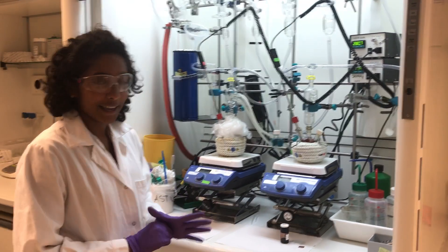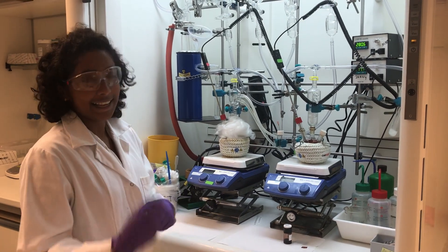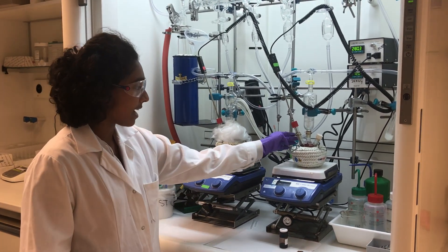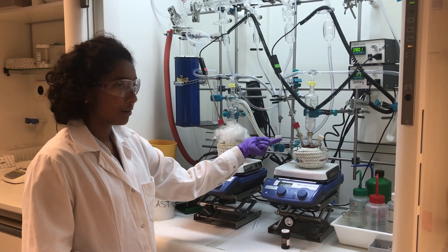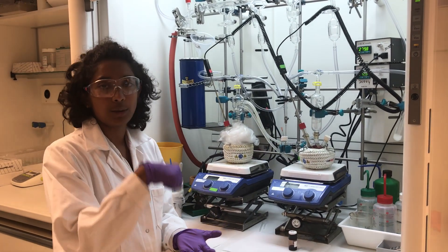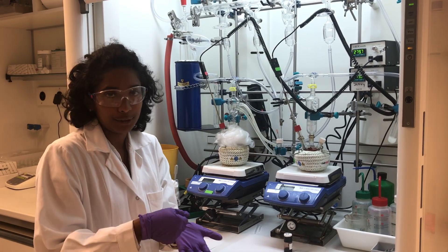It's very similar to cooking. So just like in cooking, we start with the cooking pan. Here we have a three-necked flask, which is our reactor, and then we need a lid to cover the cooking pan.